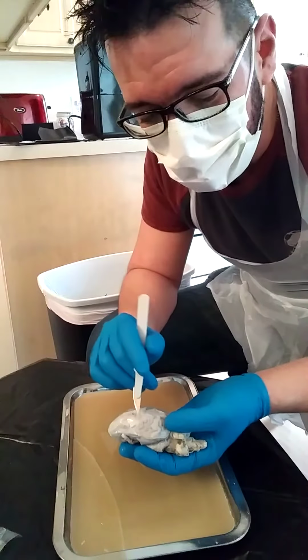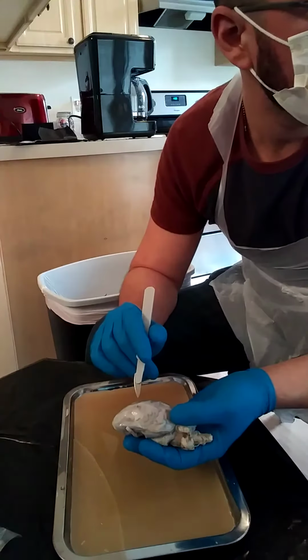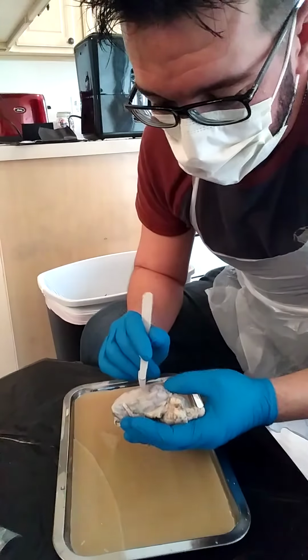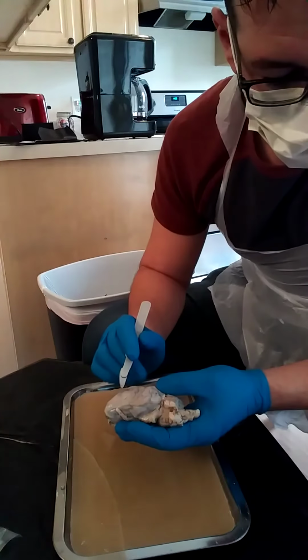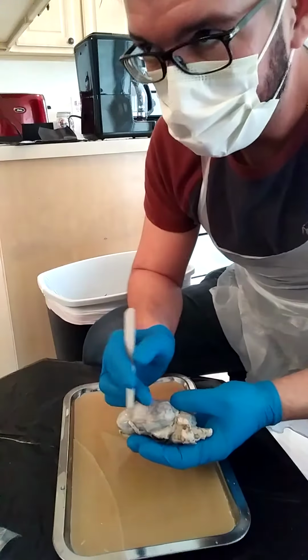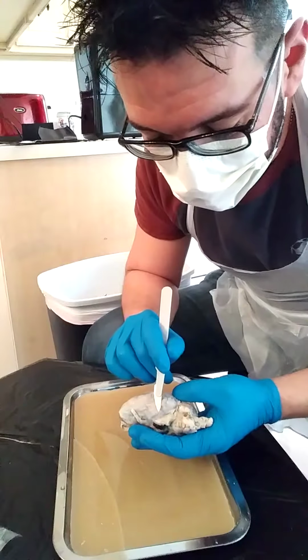So I have the parietal lobe. It's right here. It's the top part of the brain, the middle top. The temporal lobe is actually found here. Actually, I think the temporal lobe is the bottom rear part of the brain, in humans anyway. The sheep, I would imagine, is the same. It's right here.